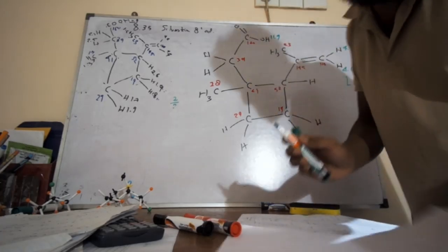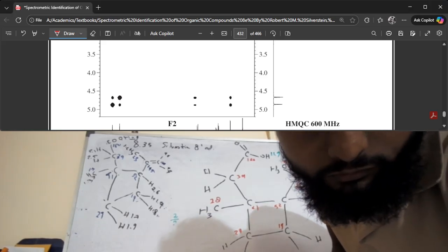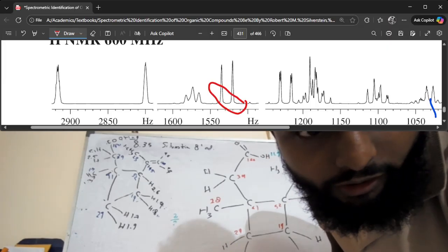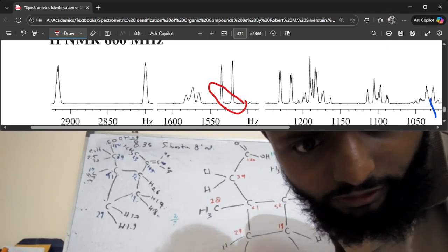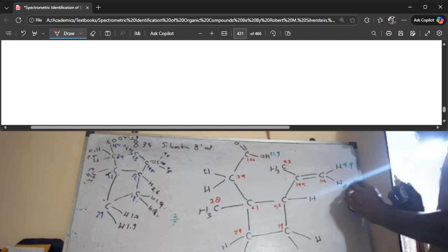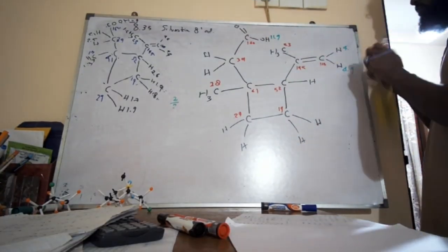But if you look at the signal, the HNMR signal, which we are going to do now, we can see that the 4.9 is kind of like a quartet. This is more like a singlet, right? 4.9 is kind of like a quartet. This is the stronger correlation. We have to change that. Okay. Right, so this is 4.9 and this is 4.6.